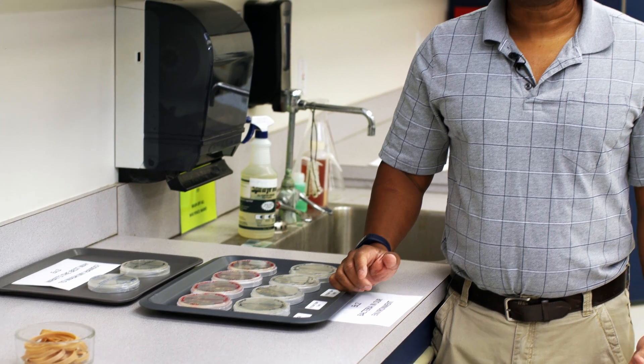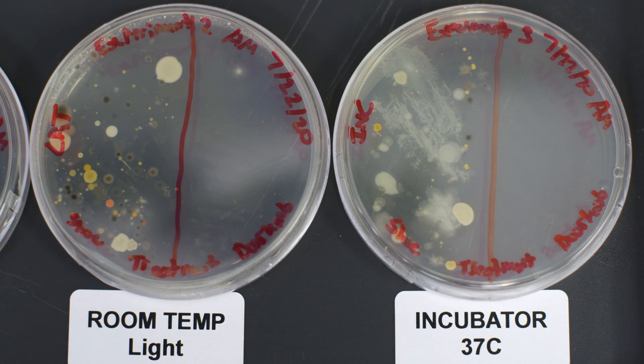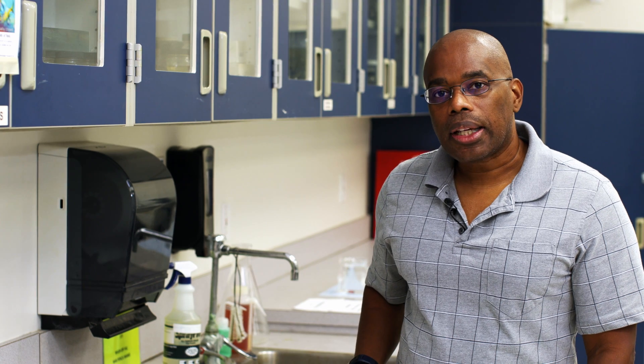After about 24 to 48 hours of growth in our selected environment, we can see the results of our experiment. In this case, we swabbed two areas — one was a shoe and the other was a doorknob — and we wanted to compare the bacterial growth present on both surfaces. We also incubated them in different environments to show how bacteria grow under different conditions: the refrigerator, room temperature dark, room temperature light, and at body temperature in an incubator. Let's look at these results and discuss why we see what we see.